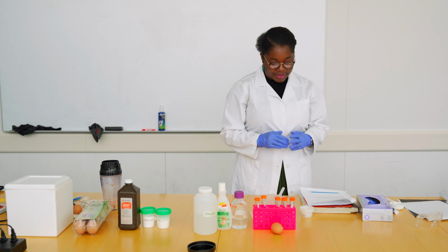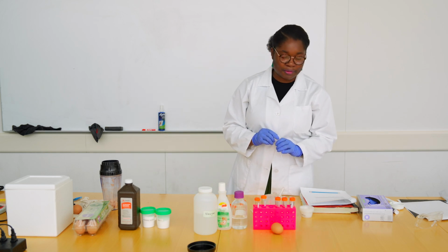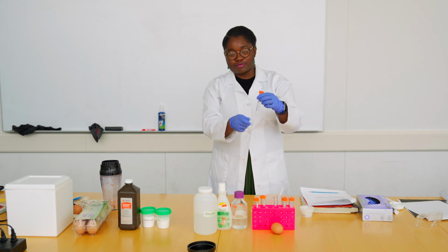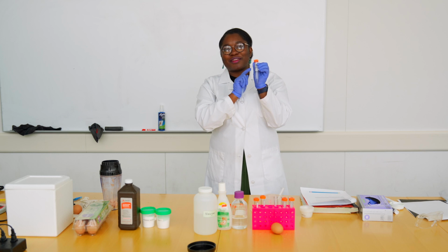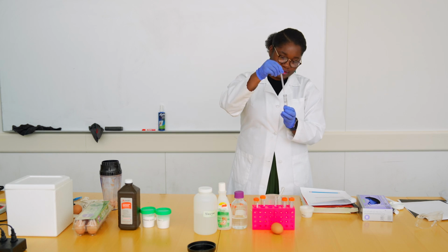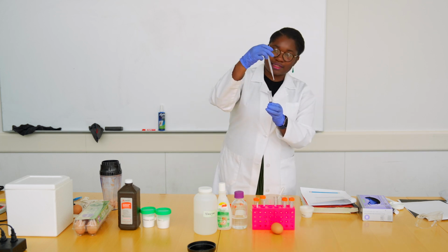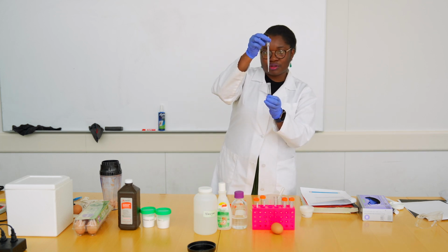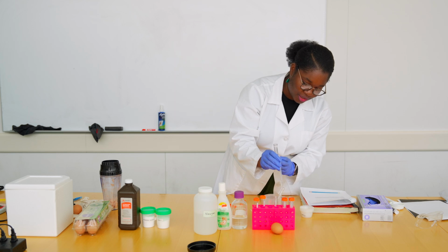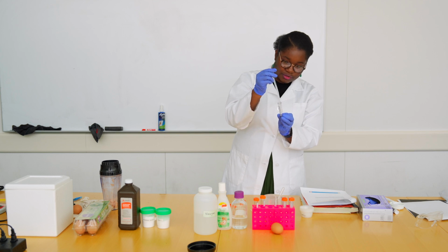Then we add our vinegar, because we are testing the effect of vinegar on the reaction with hydrogen peroxide. Which one is my vinegar? See, I was fumbling trying to find my vinegar, but my tubes are labeled so I can find it. Make sure you label. So again, we have our vinegar, new clean pipette. Get some. And 10 drops of vinegar, or you could measure exactly. As I said, there is some graduation on the pipette, so you could try and measure exactly 1 ml. And in the second tube it goes, and in the third tube, I add again 10 drops of vinegar.